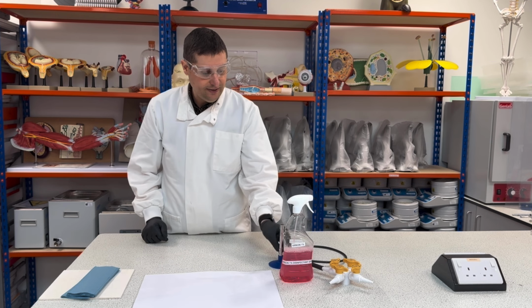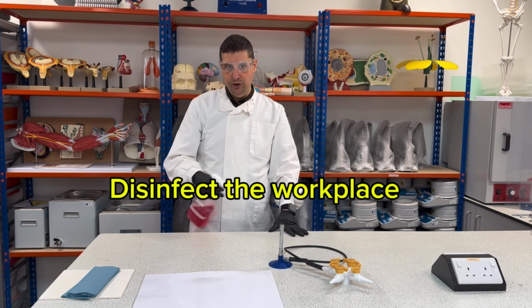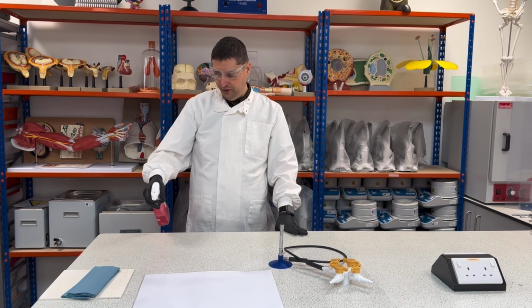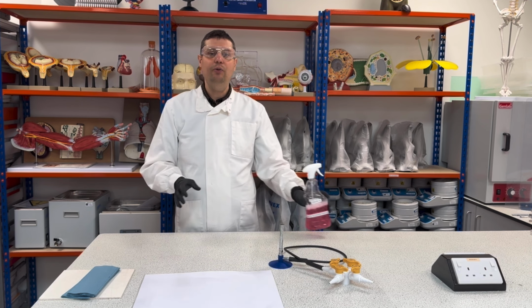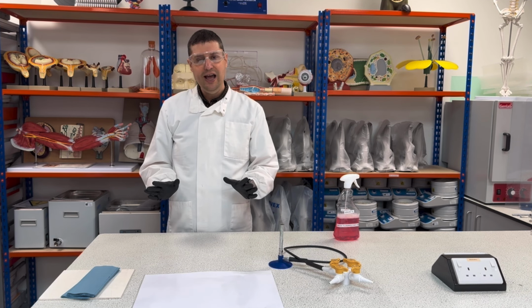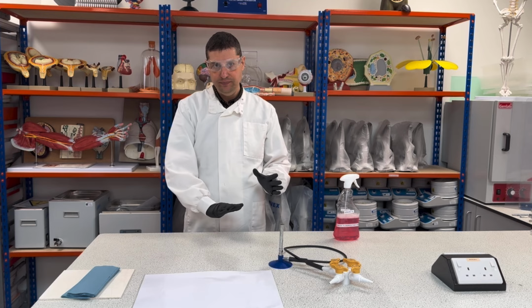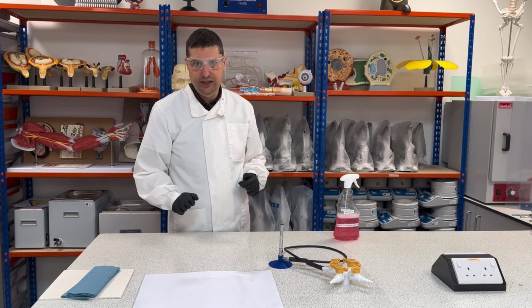First step is to disinfect the area. So we're going to be working at my workstation. I need to spray with Virkon and allow it to set for about 1 minute. Okay? After 1 minute, you can wipe it off, and then you take your A3 workstation.